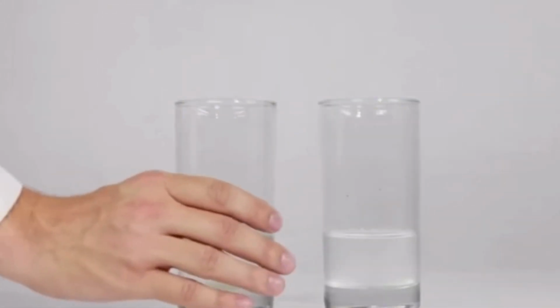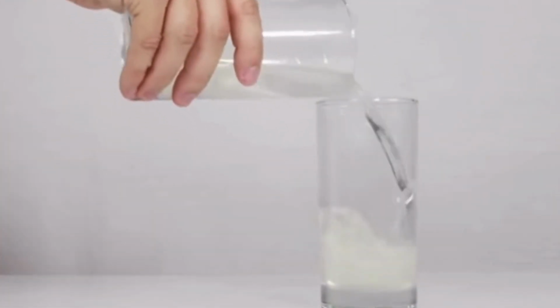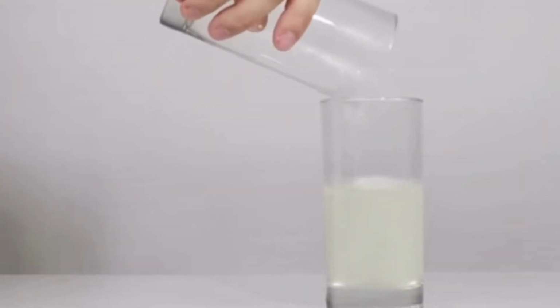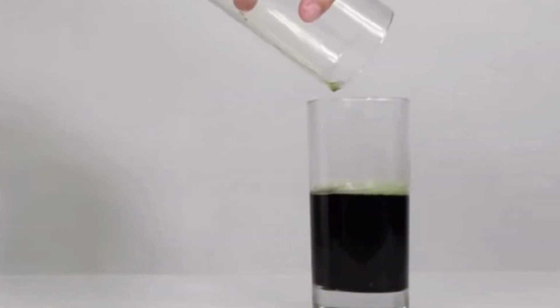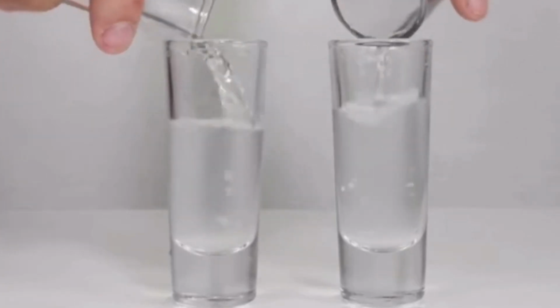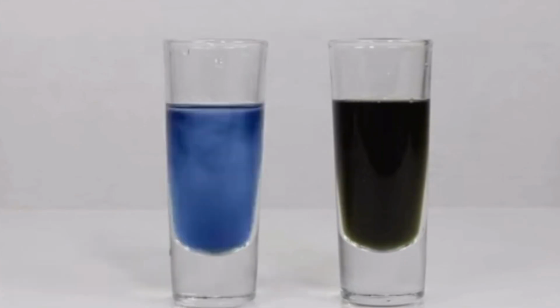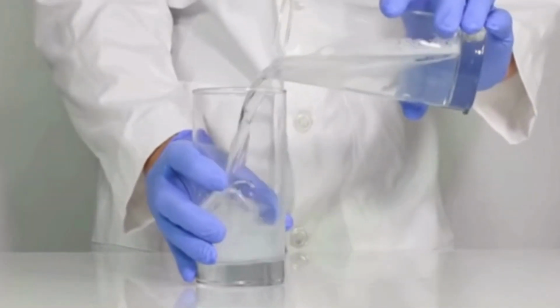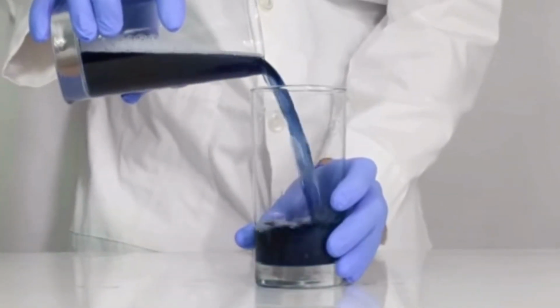accurately with a stopwatch. Next, chemical oscillations are dynamic processes in which complex feedback loops cause periodic changes in reactants and intermediates. The reaction system used here demonstrates color oscillations resulting from redox reactions involving iodide ion, iodine, and hydrogen peroxide. Iodine is detected visually by starch, which forms a dark blue compound. A sequence of redox reactions is carried out by the reactant in the oscillating iodine chemical clock reaction.